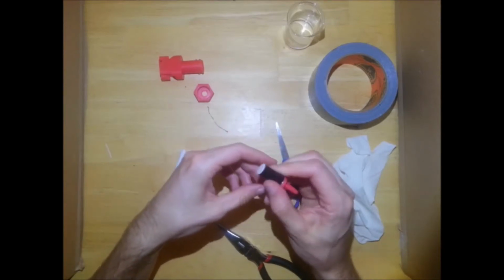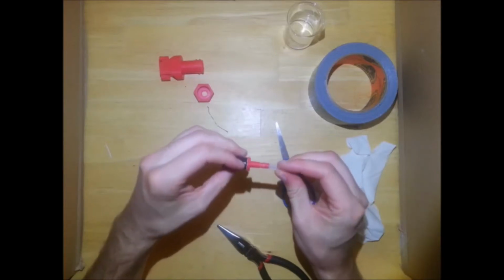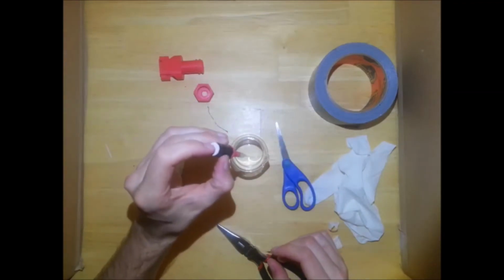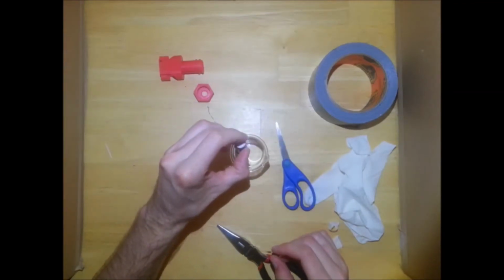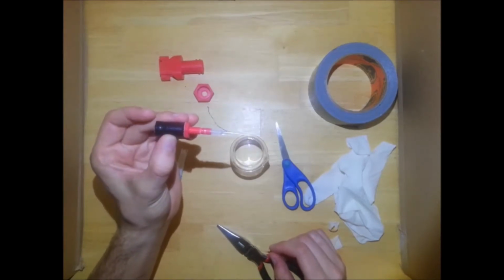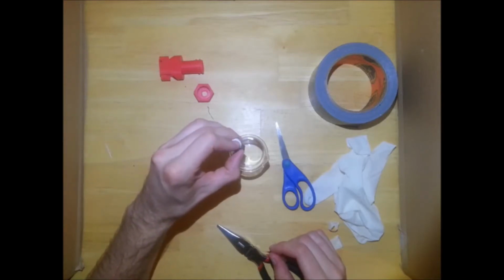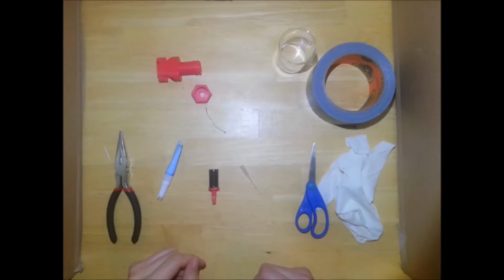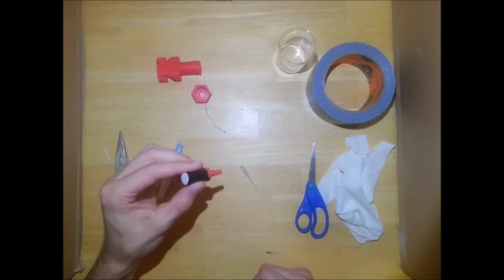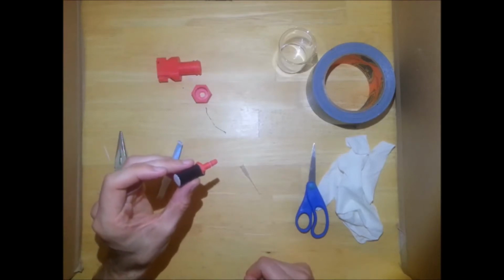And if this all works well, then you should be able to apply a standard 2 to 20 microliter pipette tip. Press down on the membrane and take up somewhere between 10 and 20 microliters of fluid, and then just as easily dispense of it. The accuracy of the pipette is highly dependent on the ability to maintain a perfect airtight seal between the rubber membrane and the liquid you're trying to measure out.